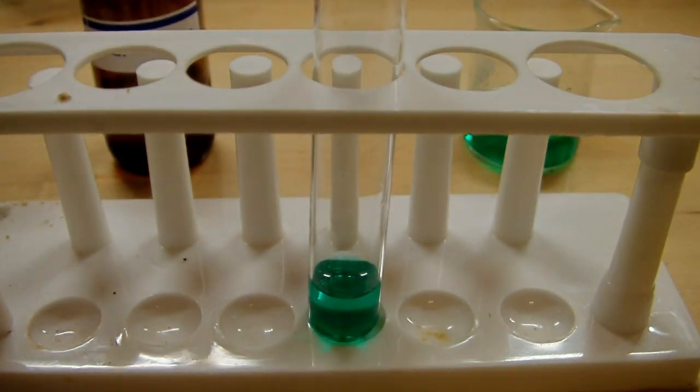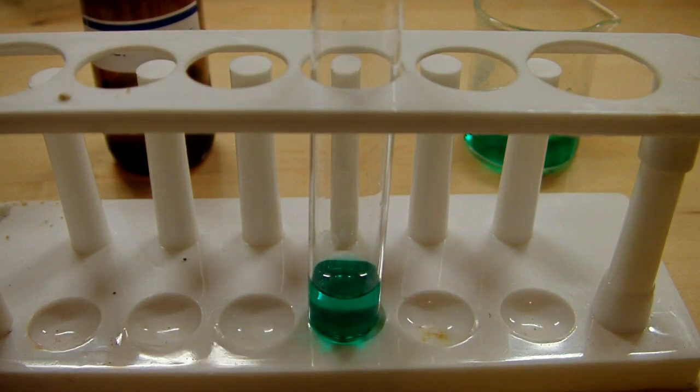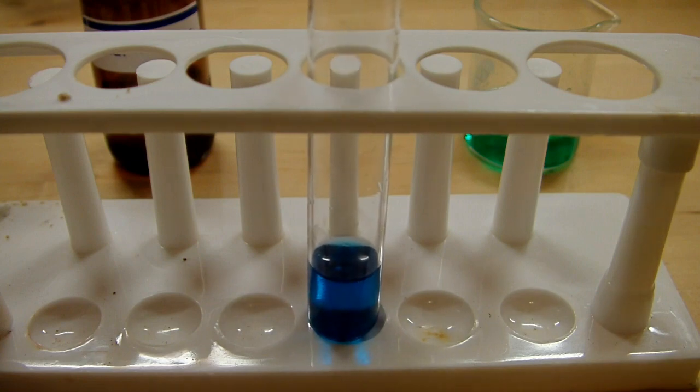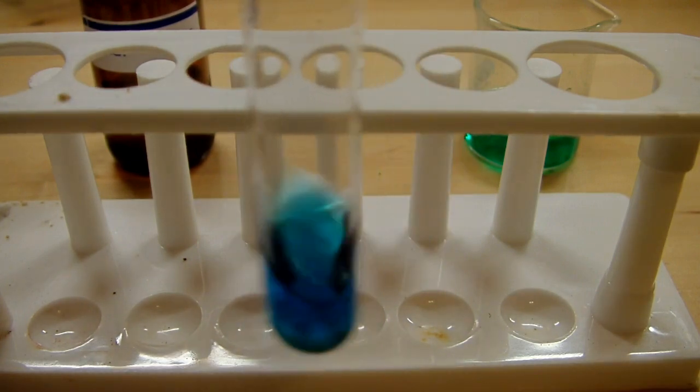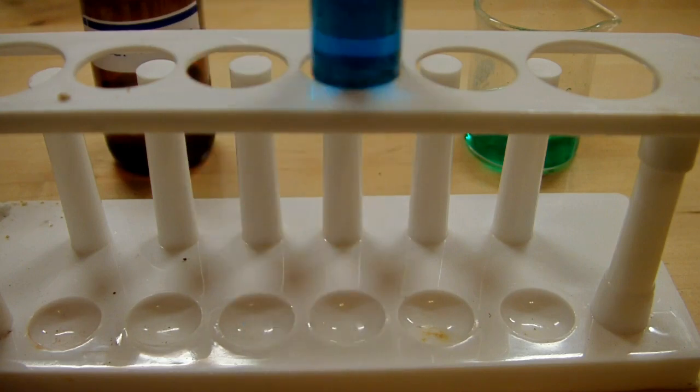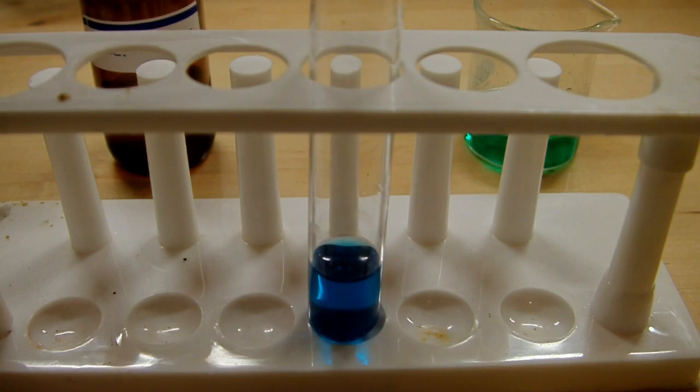It's a bit darker green, so I'll add another milliliter. And you can see we're starting to get this really beautiful color change from that deep emerald to a really deep royal blue.